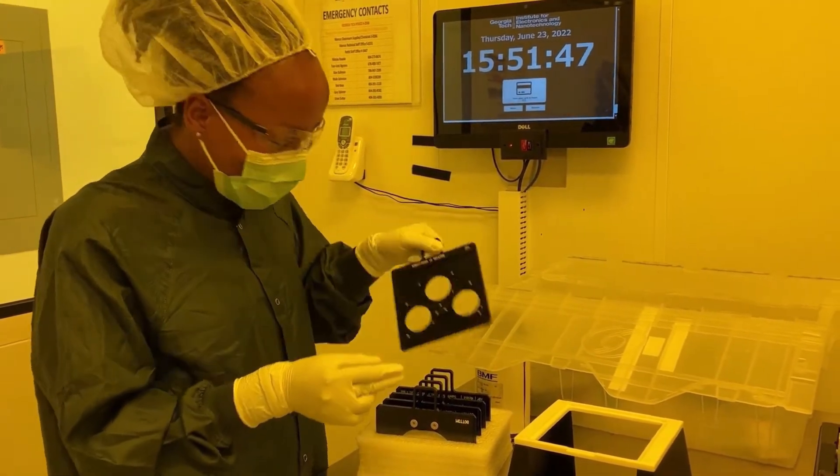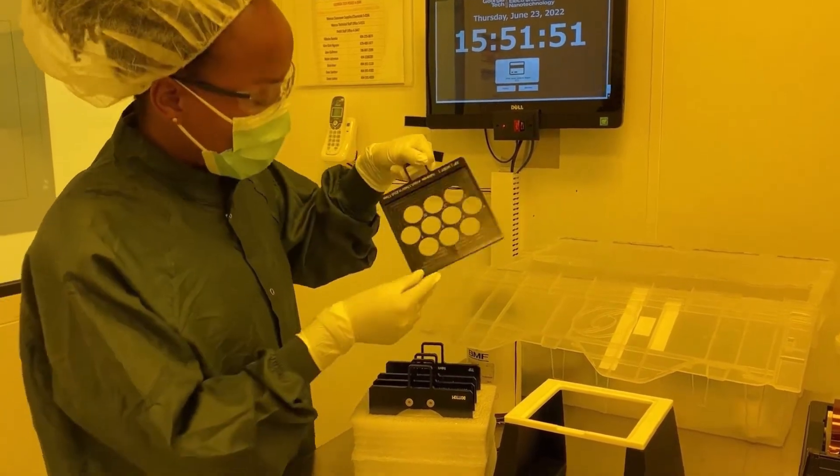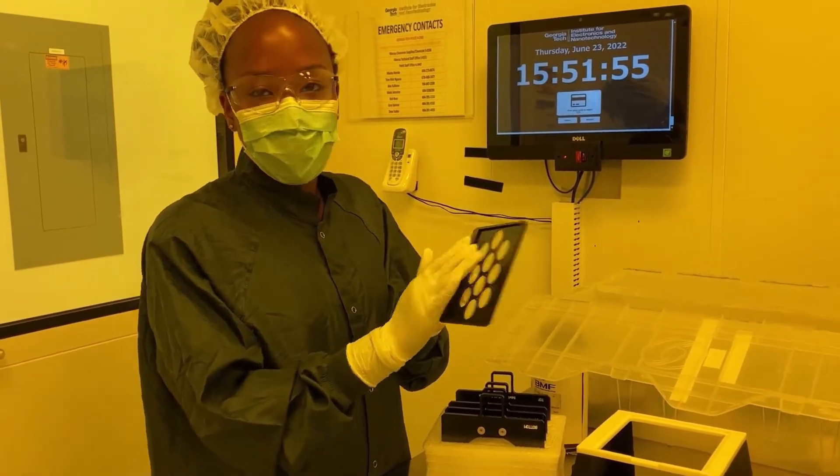The first one is used for 2-inch wafers. The second one would be used if you were trying to do oil immersion, for which you would use very thin microscope slides as a substrate.